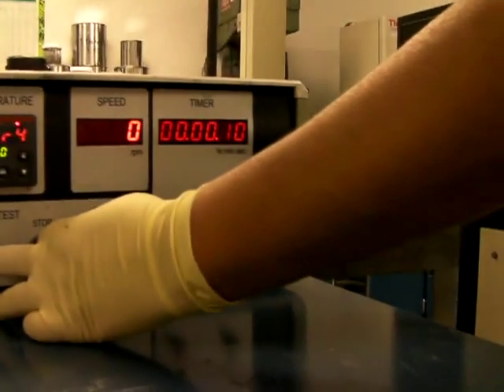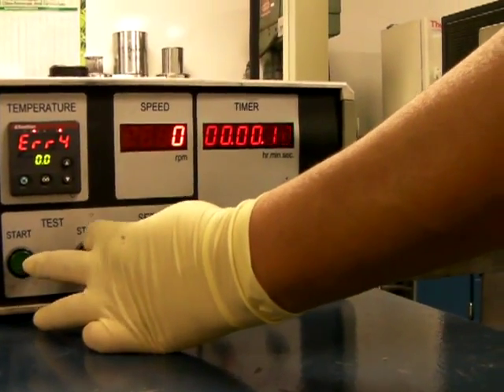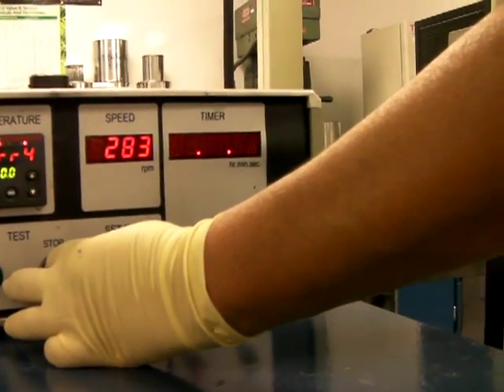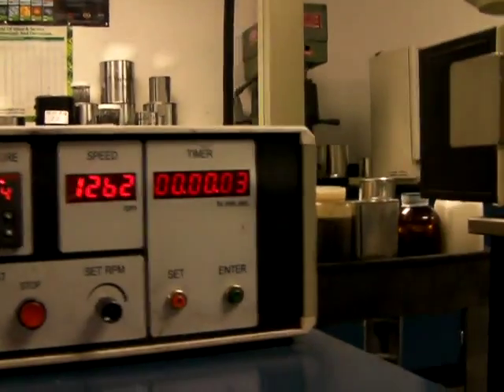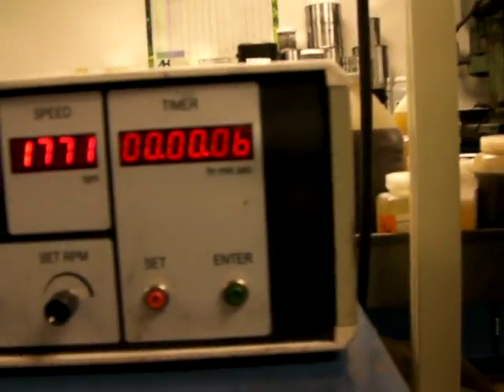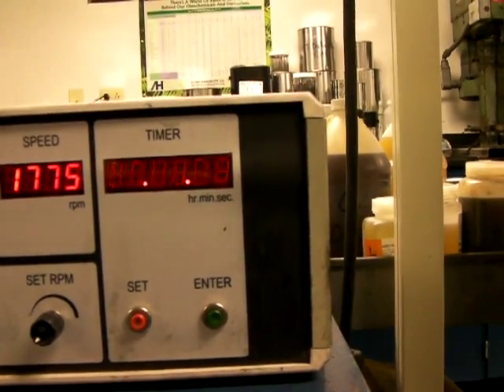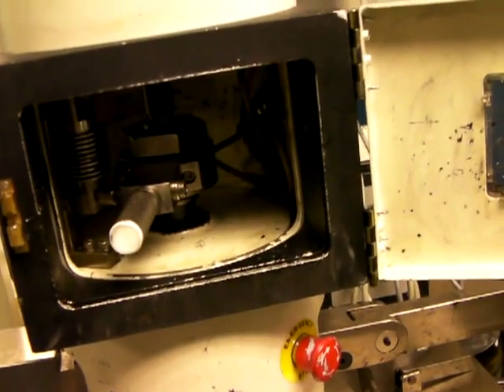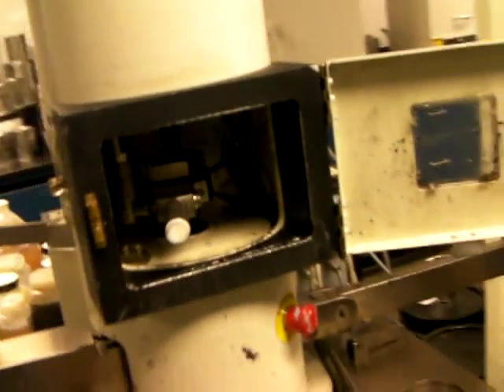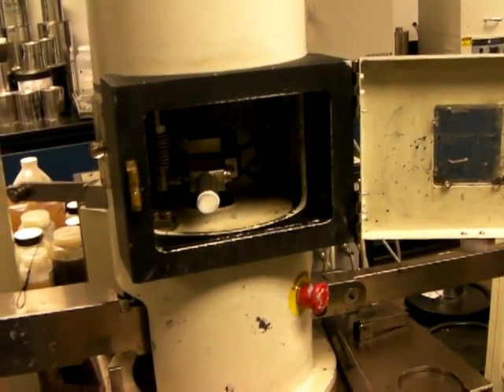Okay, ready to go. There we go. Any smoke? No. Didn't weld. Am I correct in saying it did not weld? No, it didn't. Good. And we're going to make a second video at 800 kilograms.